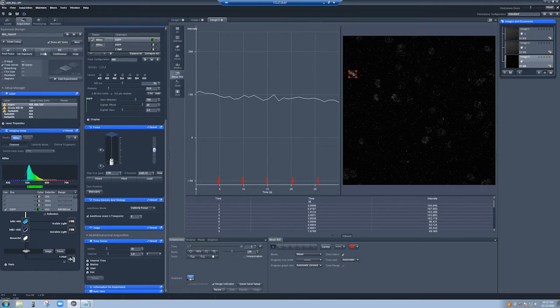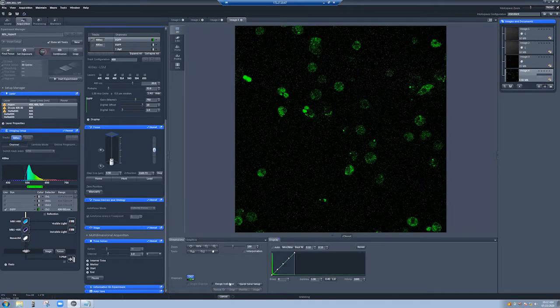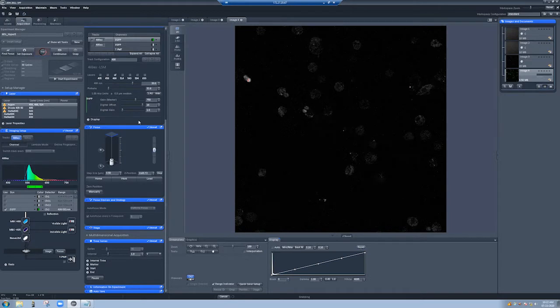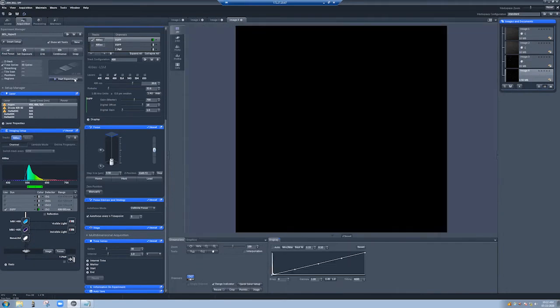So let me go to live. So now we can sort of see everything very clearly. I'm going to reduce the gain a little bit to 700, just so that it's not saturated. And now I'm going to try this experiment again. So let's see how the bleaching curve compares to this. So let's go to start experiment.